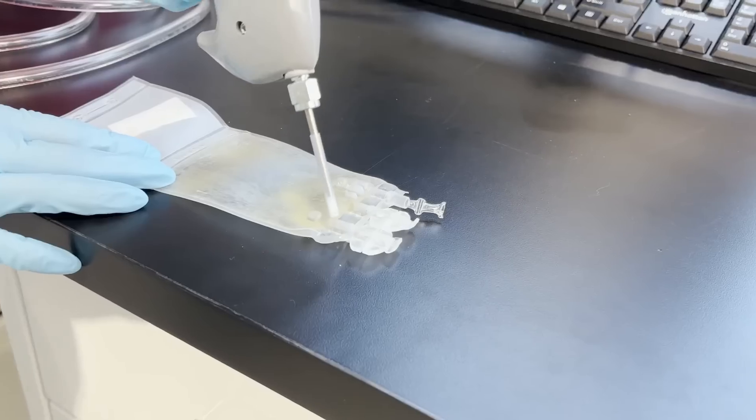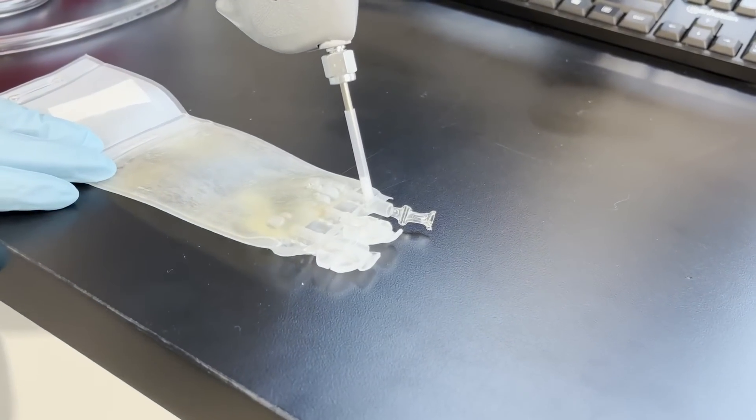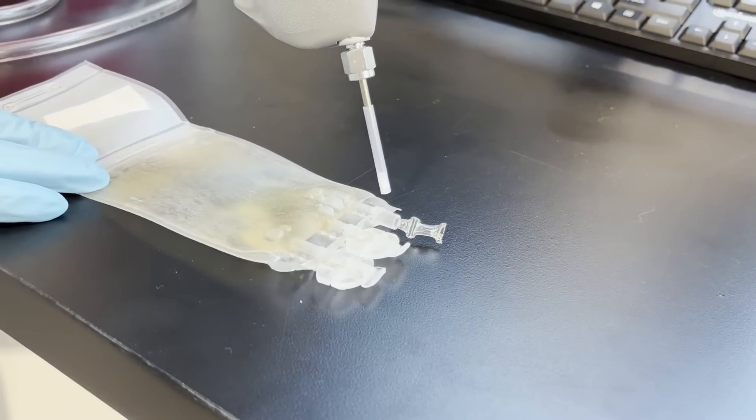This is to isolate seals of interest on the specific package system to ensure only leakage from the package seals are detected and not a separate source. The efficacy of the fixture to sample seal is tested during protocol design to verify this. While under a vacuum, 100% helium gas is continually injected into the closed sample at the opposite end, which is open to the environment, utilizing a flow meter and a dispensing needle.